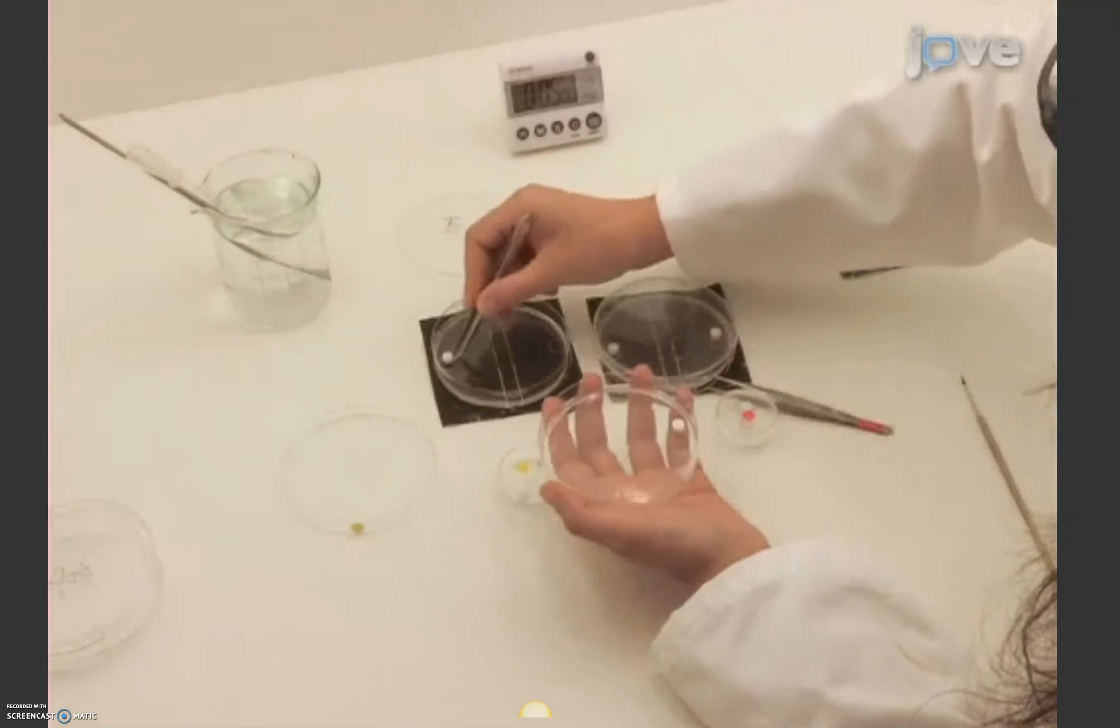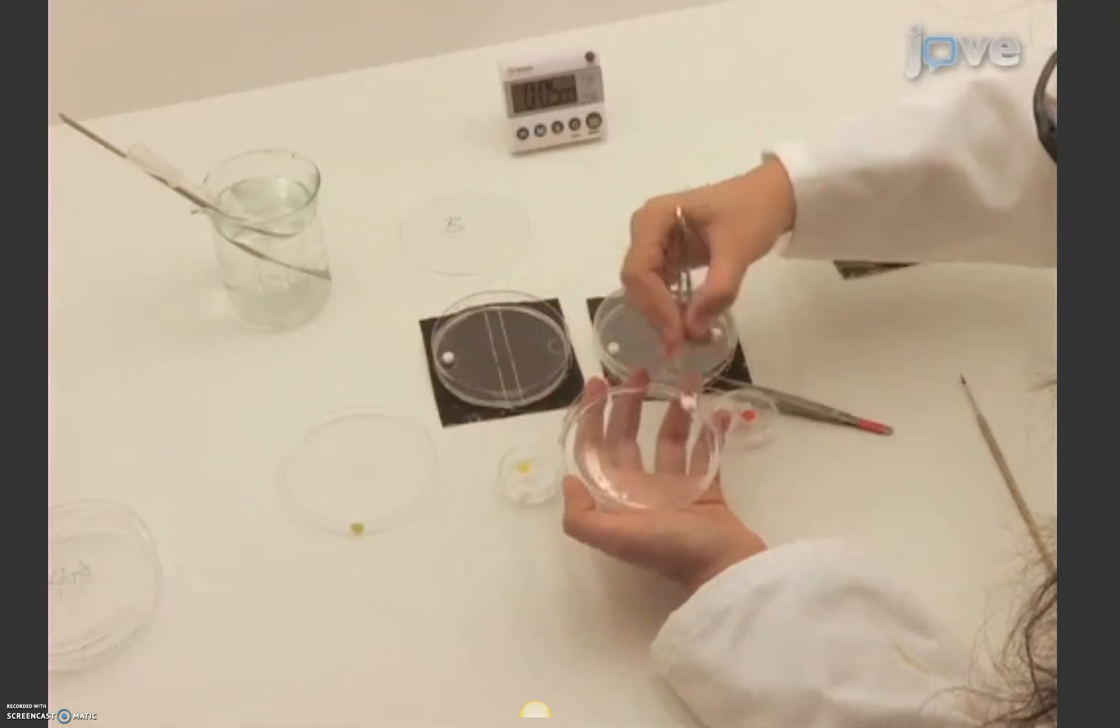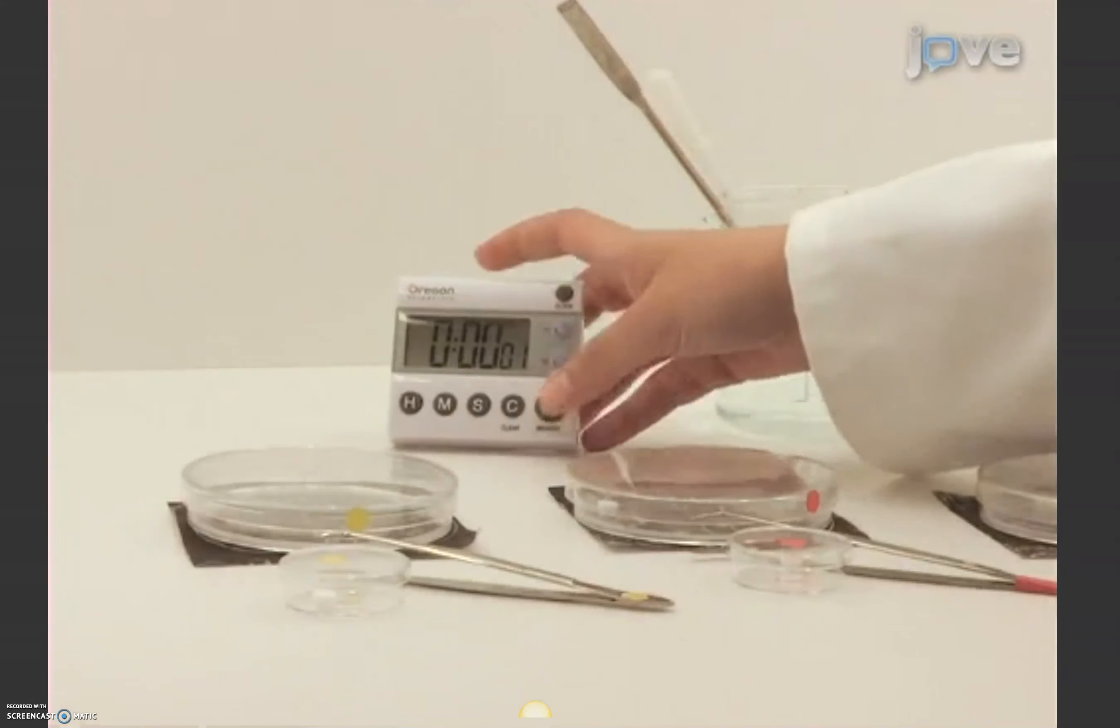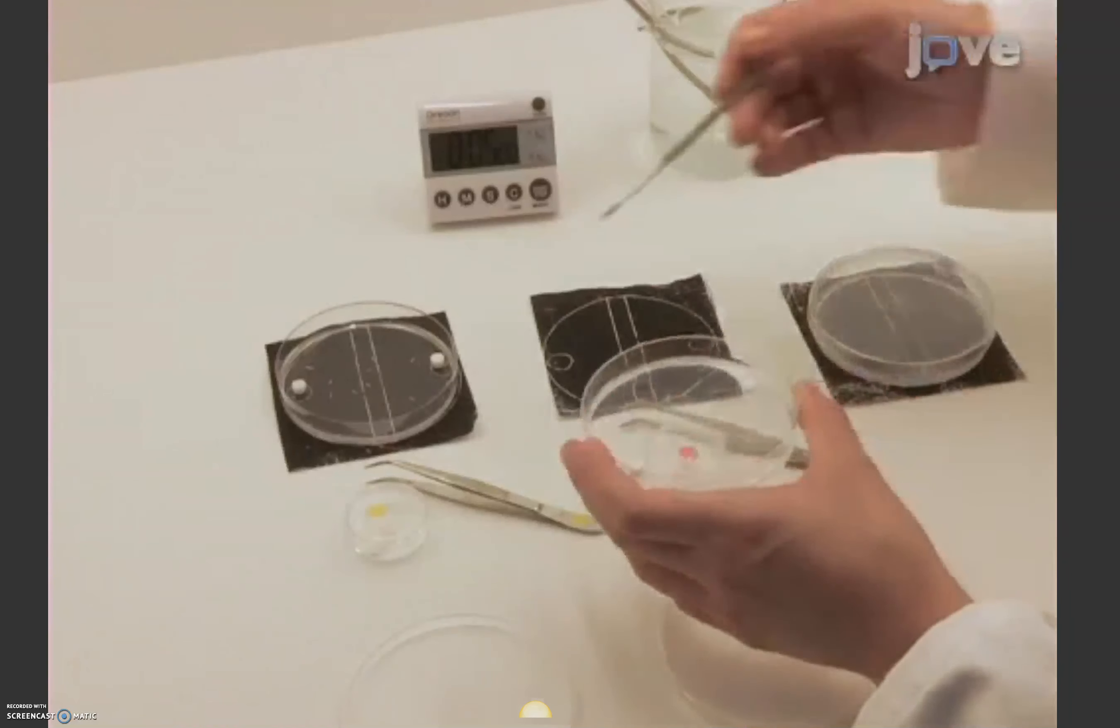Execute 2 more rounds of training in the same manner as the first, transferring the animals by a moistened brush and exposing them to each stimuli and reward combination 3 times in total.